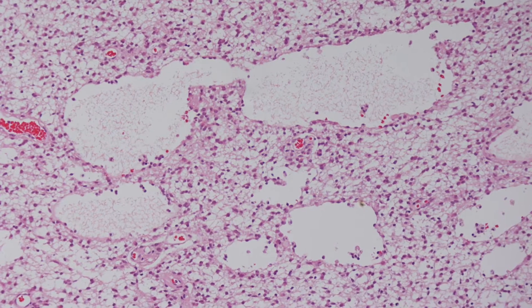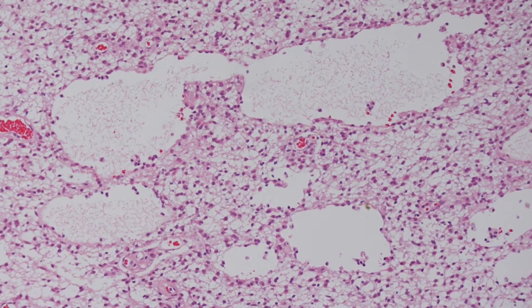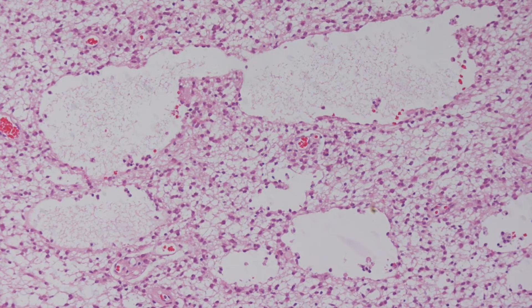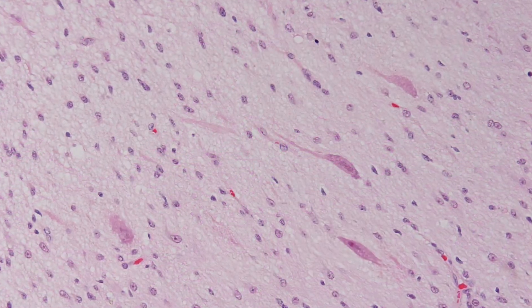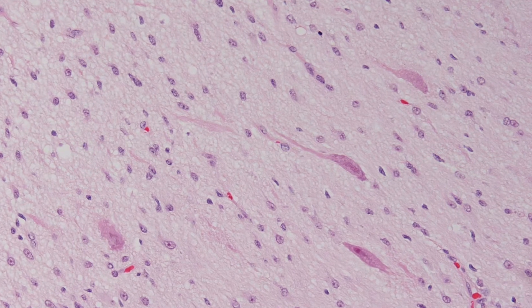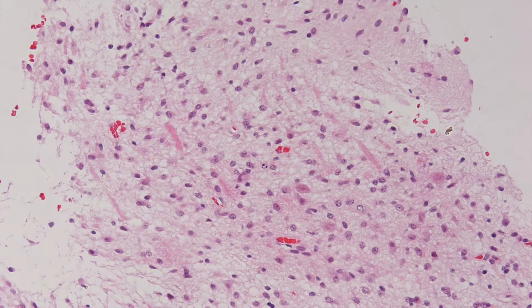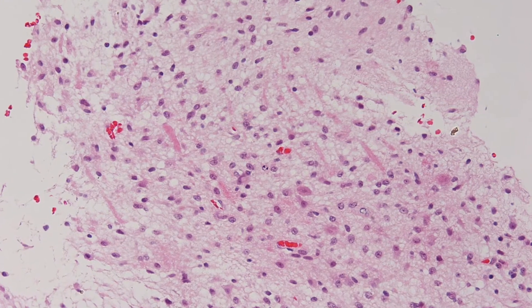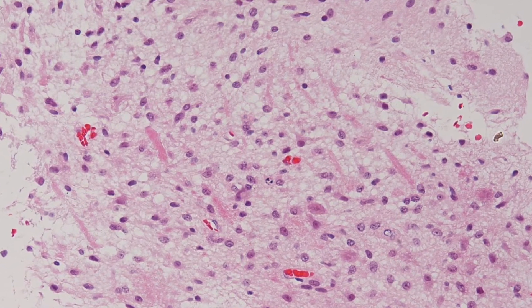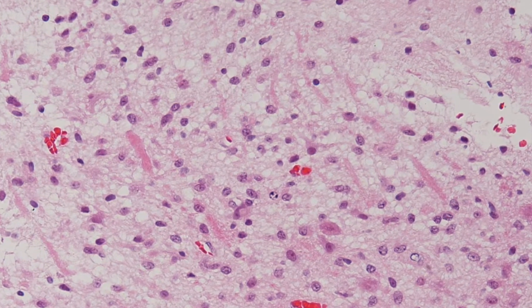Here is another view, and here are a couple of high-power views. Here you can see some thick red rod-shaped structures. These should give a bit of a clue.